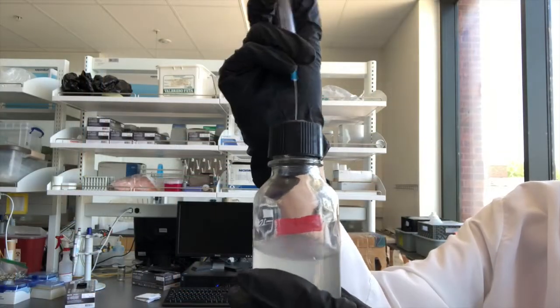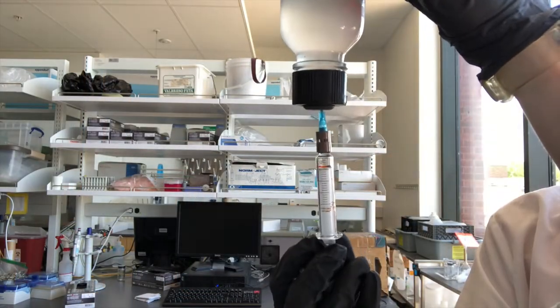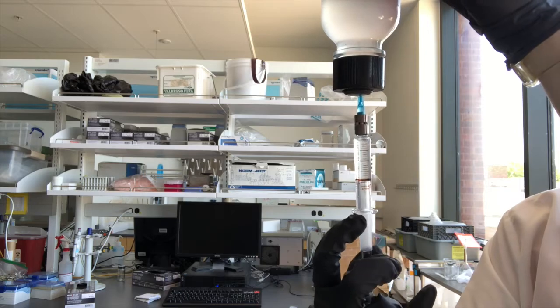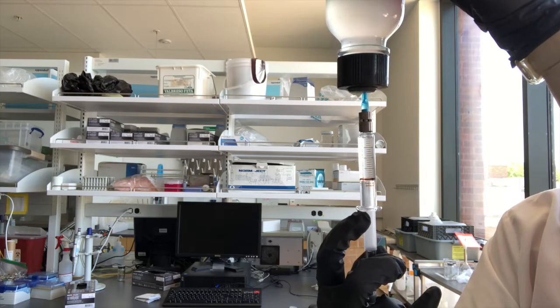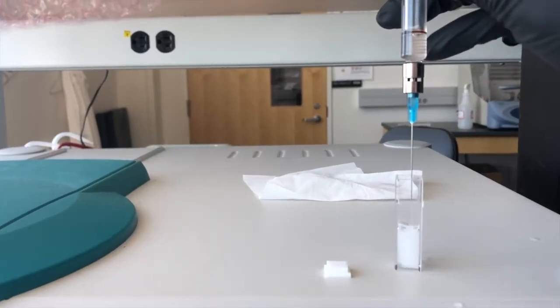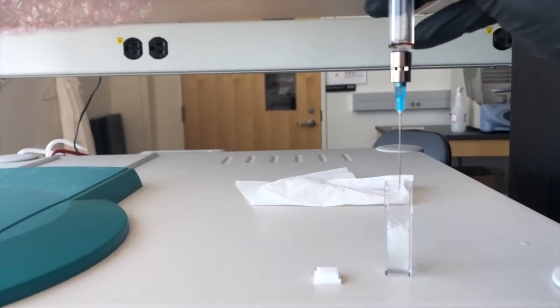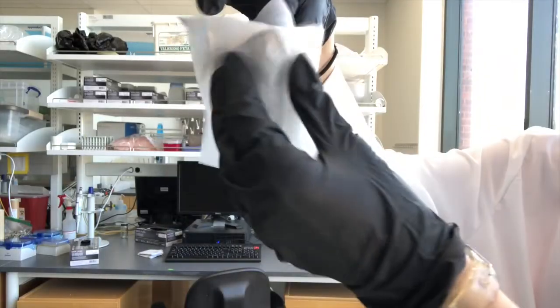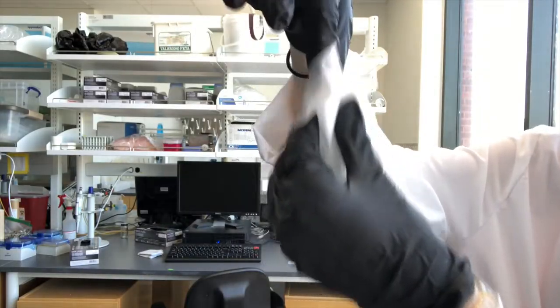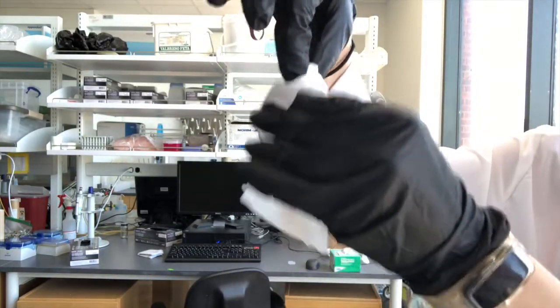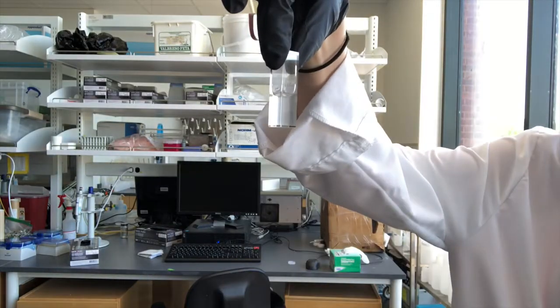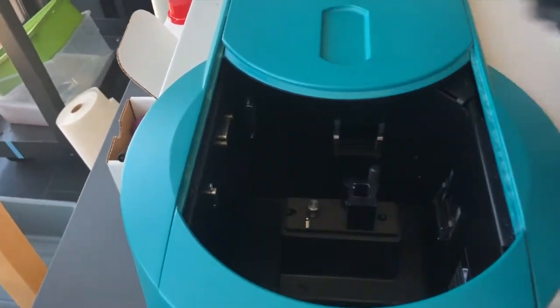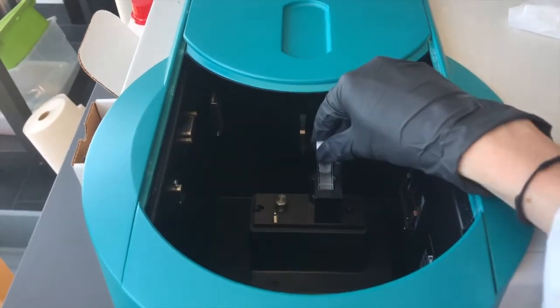I'm starting off by taking that sample from the bottle with a glass syringe and I'm taking two milliliters out and transferring that to a four-sided quartz cuvette and then wiping down the sides of the quartz cuvette to make sure they're nice and clean before I put it into the spectrophotometer.